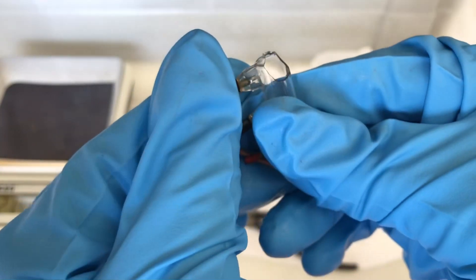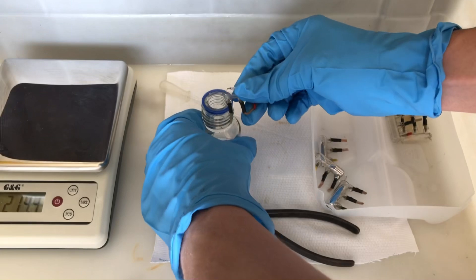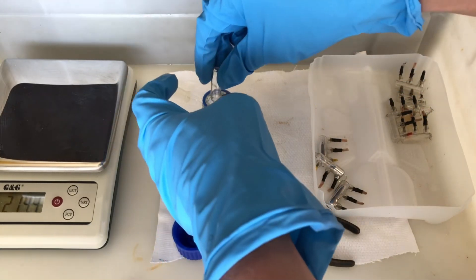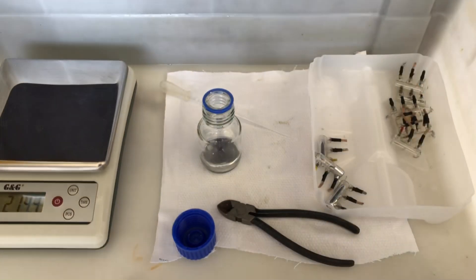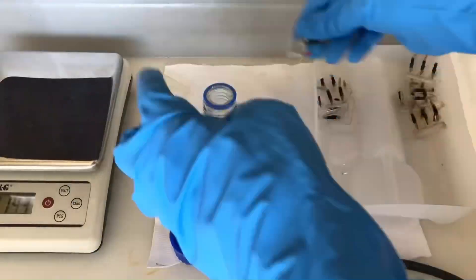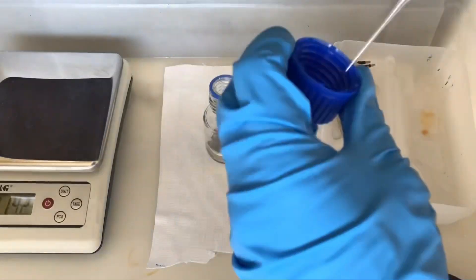One of the switches decided to break completely at the top, and this could happen to the entire switch. If it breaks, it could end up breaking down to the bottom, just spilling the mercury while you are opening the switch. And you don't want mercury around in your house or even on your lab floor.